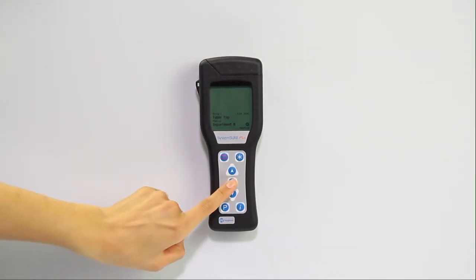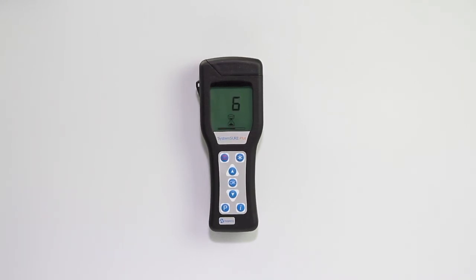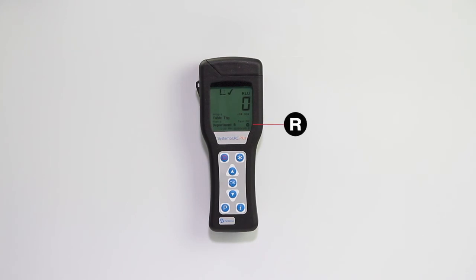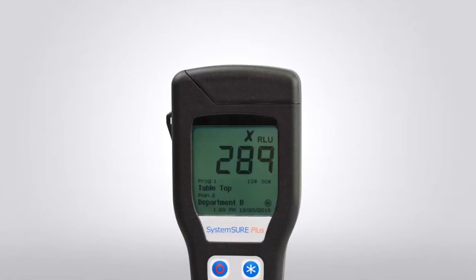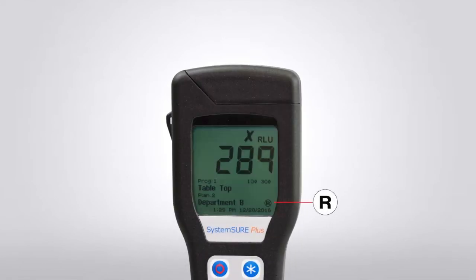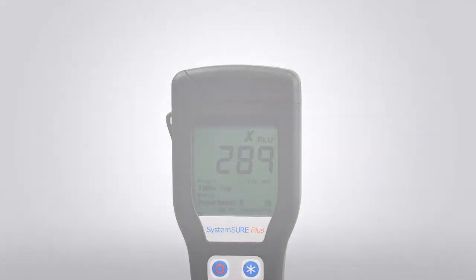Hold the meter upright until the result is obtained. Retested locations are indicated by an R in a circle. Retest results are indicated by a white R in a black circle. Please note that retests can only be performed on failed test results.